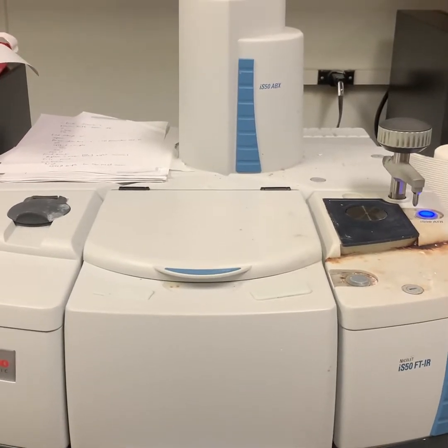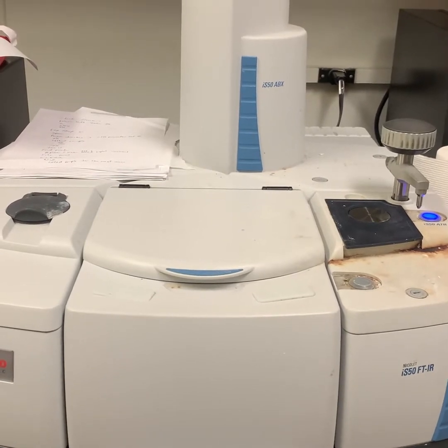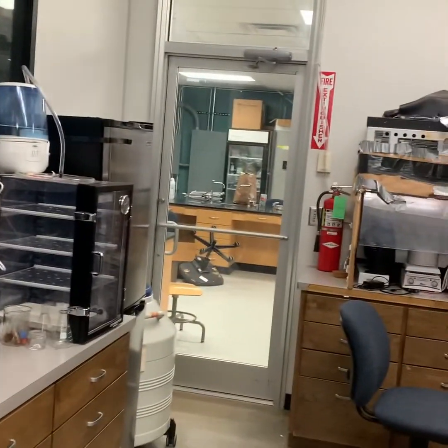Hi everyone, this is Keegan Nouse, and this is my little video showing you just how to run a quick sample on the FTIR here in the organic chemistry lab, in between the organic lab and the biochem lab.